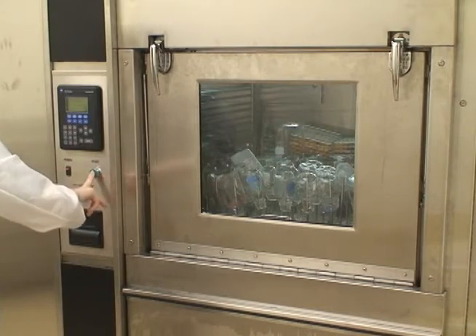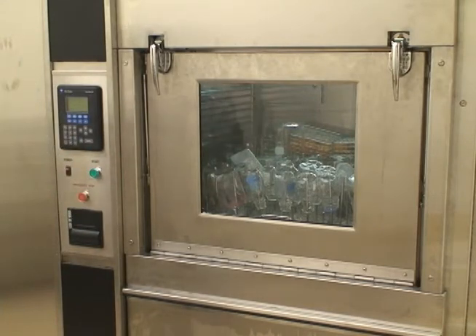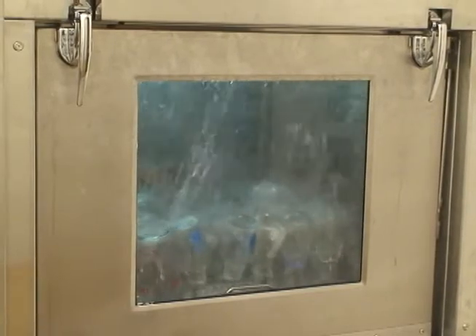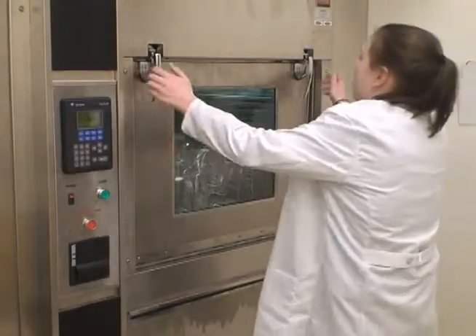The dishwasher will pause if the temperature of the water goes below 100 degrees Fahrenheit, indicated by the screen on the left of the dishwasher. 180 degrees Fahrenheit is the ideal temperature for the dishwasher to run at.